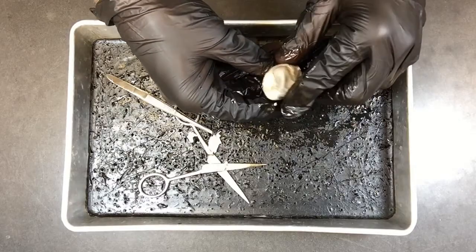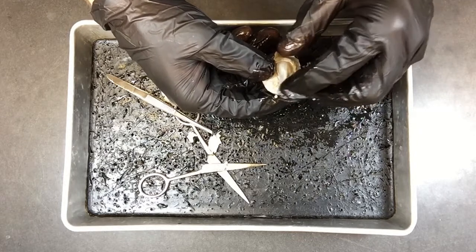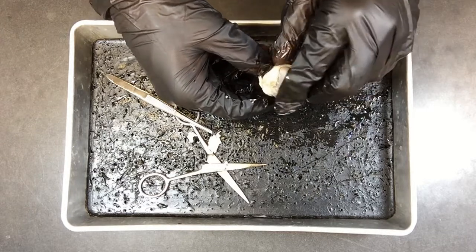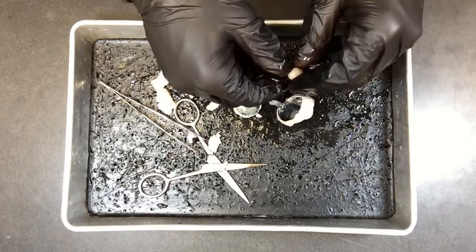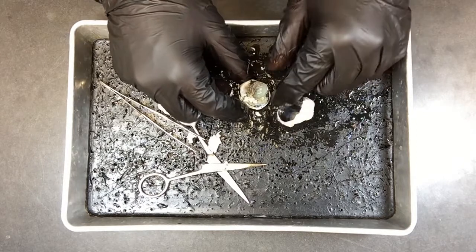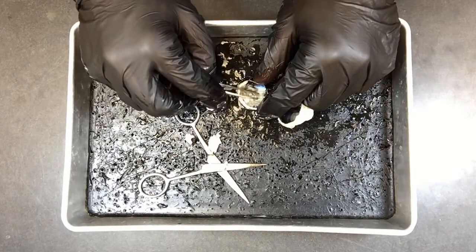So what we have here is the front of the eye. Here is the cornea, which is a thin protective layer on the front of your eye that also refracts light onto the convex lens inside your eye. Here we have the convex lens, which will refract the light further onto the back of your eye here, where we have this thin little tissue right here, which is called the retina, located on the back of the eye.